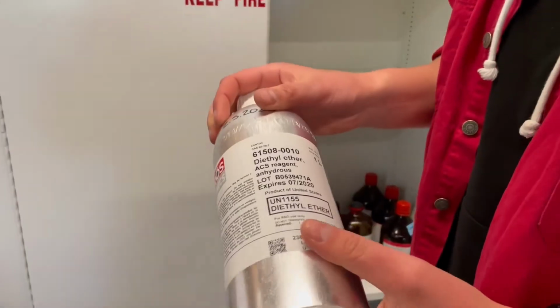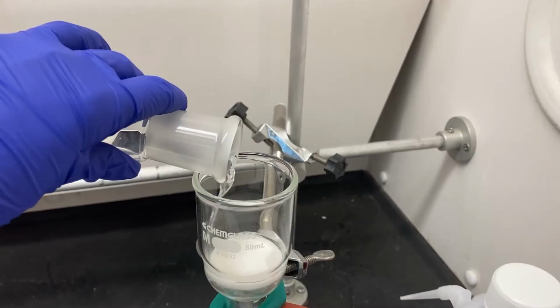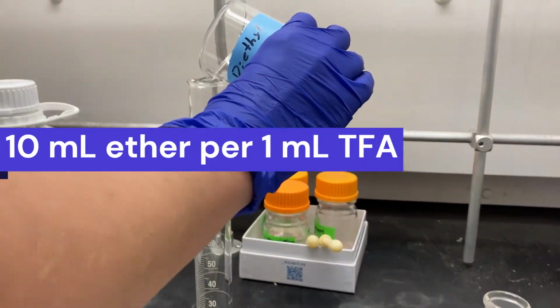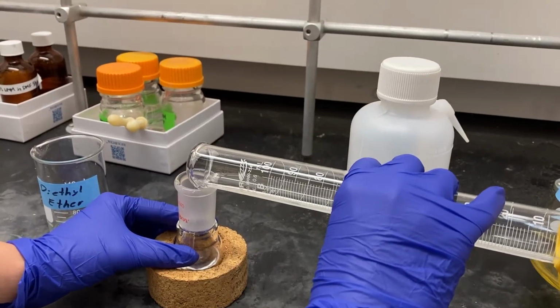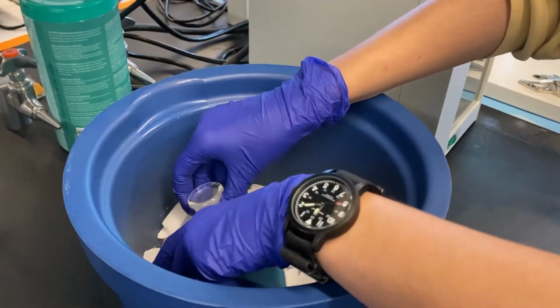We use cold ether to force our peptide into a solid state known as precipitation, and then filter it from the liquid waste. Our procedures call for 10 milliliters of diethyl ether for every 1 milliliter of TFA used in cleaving. Measure out the corresponding amount of ether for your peptide and transfer it to a round bottom flask before chilling the ether on dry ice for at least 10 minutes.